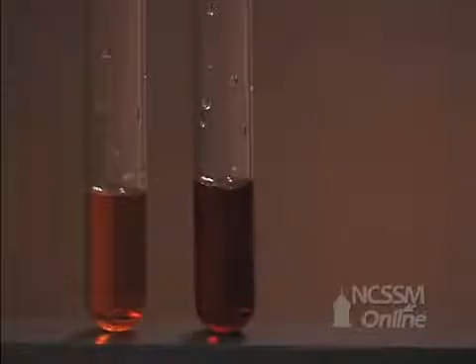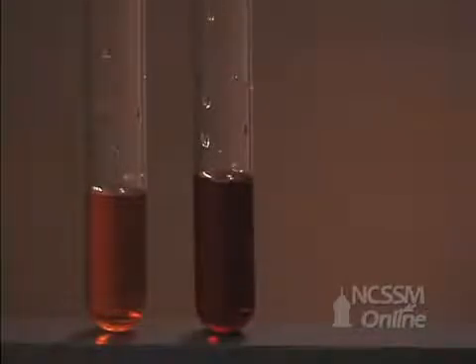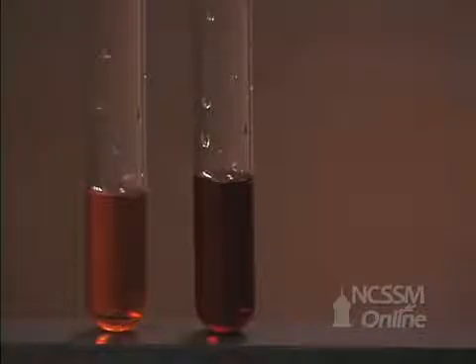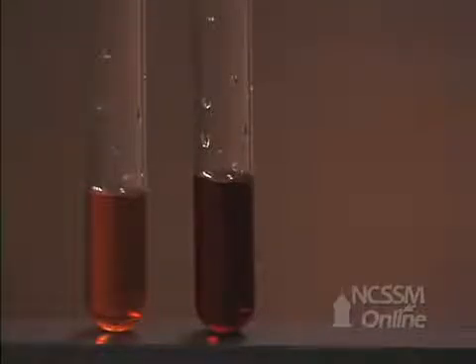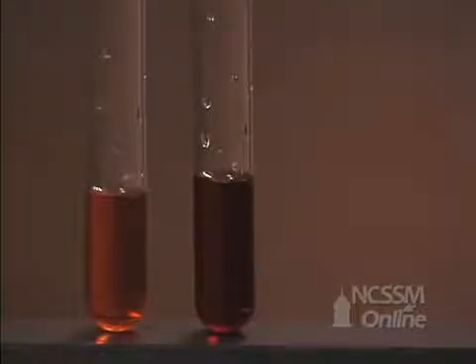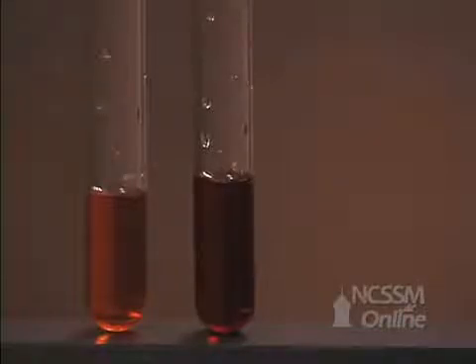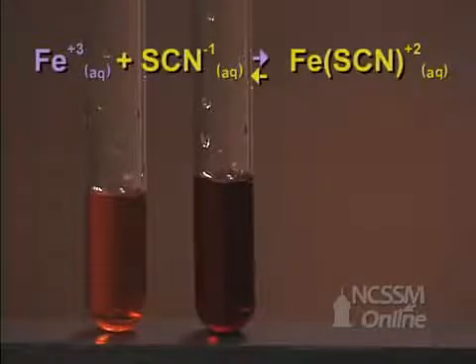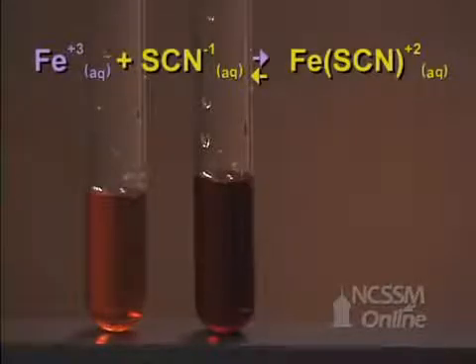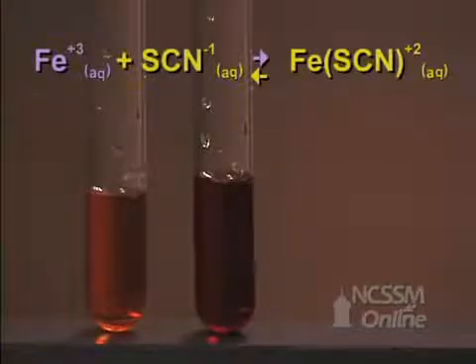We see that there is an increase in the dark red color. This indicates an increase in the concentration of the complex ion, and also indicates that the reaction has shifted in the forward direction. As you add reactant to an equilibrium, the reaction shifts in the direction to use up the added reactant — in this case, the forward direction.